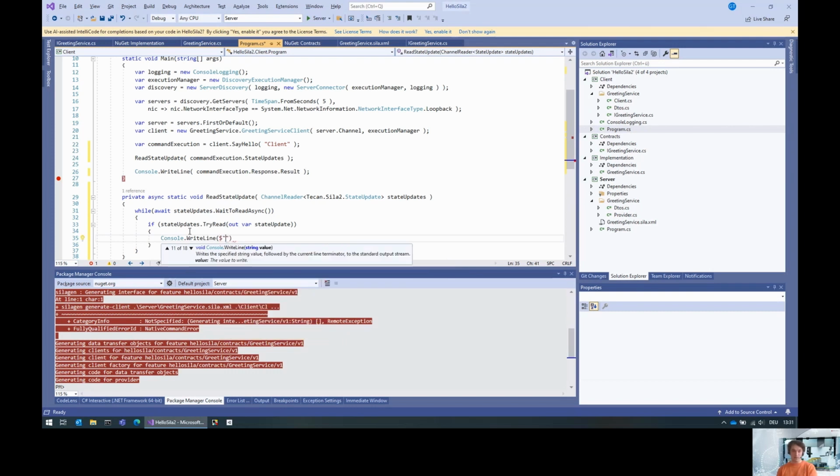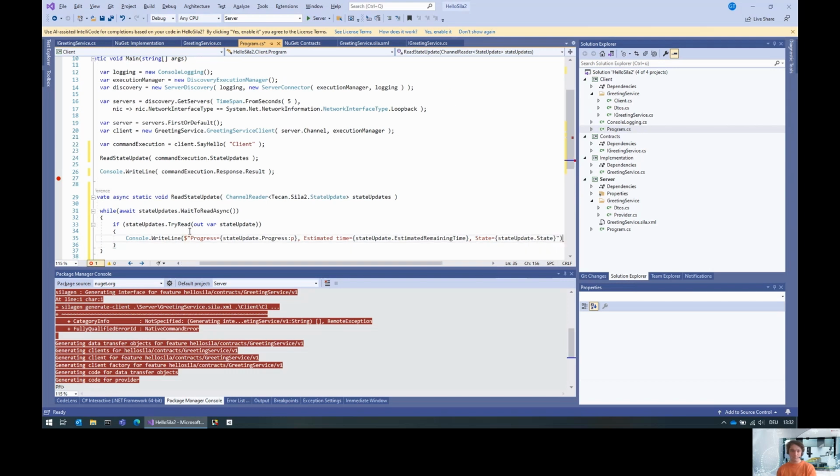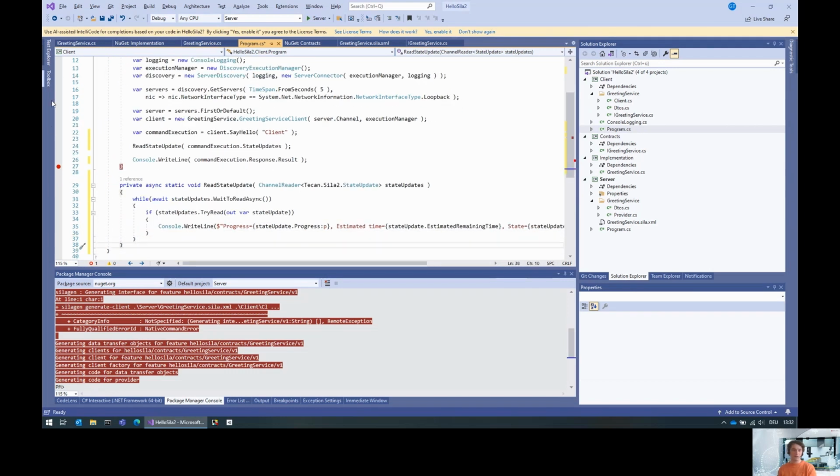And if we fetch a state update, we do a console write line to say, okay, the progress is state update dot progress, P means percent. Then the estimated time is state update dot estimated remaining time, and the state is state update dot state. Cool.